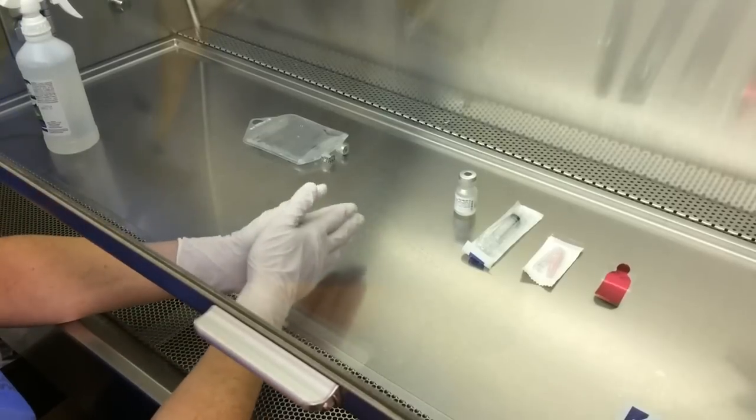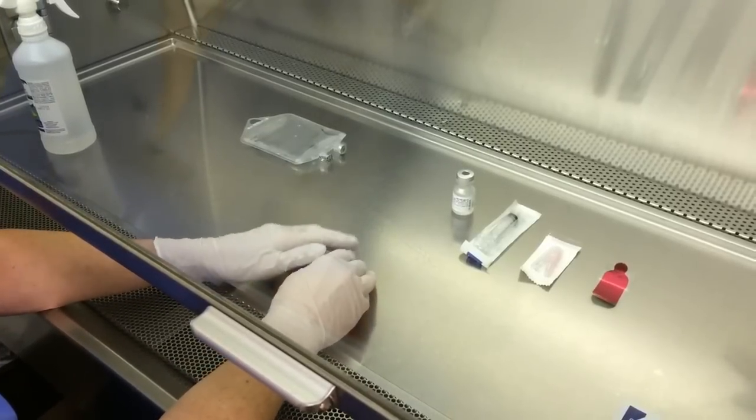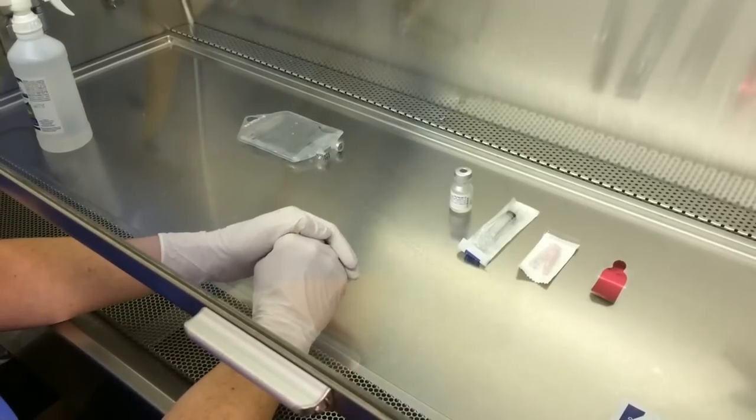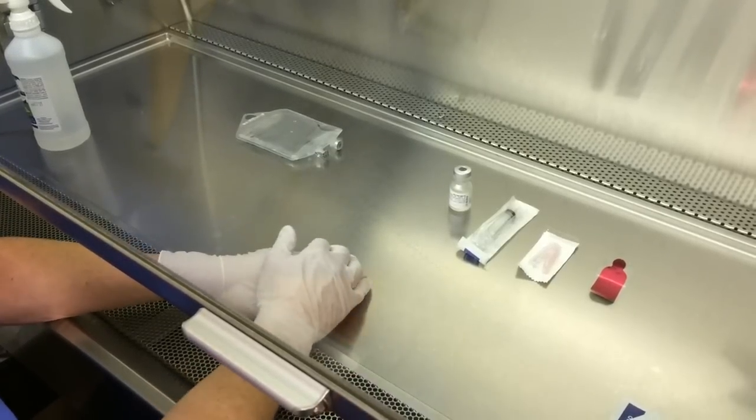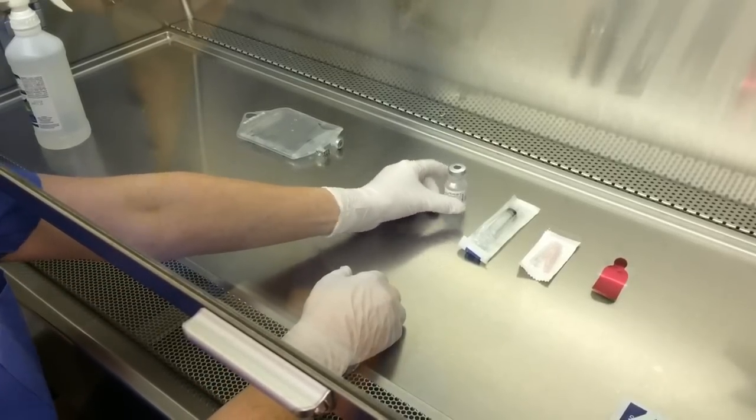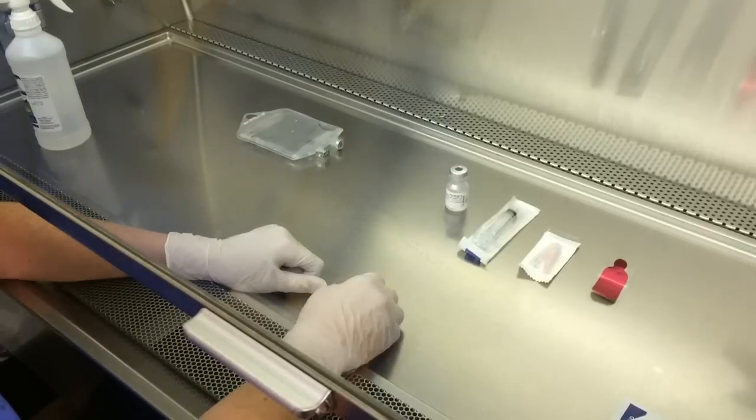When you're working with your products, you want to make sure that you are not going over the top of your products after you have alcoholed them. You can grab the vial from the back, but just don't go over the top of this area.